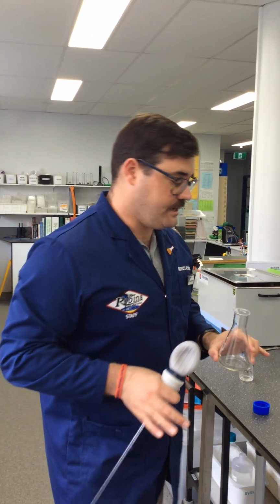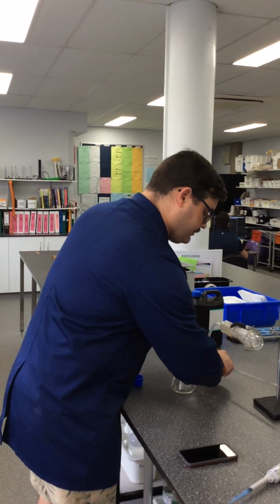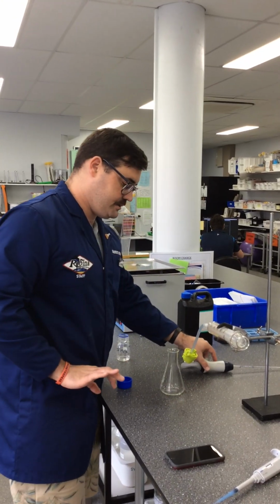Now today I'm taking a little bit of time because I'm obviously explaining it to you. Hydrogen peroxide though is very, very sensitive to the outside environment. So it can actually start degrading and breaking down immediately. So in a normal experiment, if we wanted to reduce the error and make it as accurate as possible, we'd be taking this straight from the stock bottle into a smaller beaker and then taking a sample immediately so that we minimize that risk. All right, then we are going to put that off to the side.